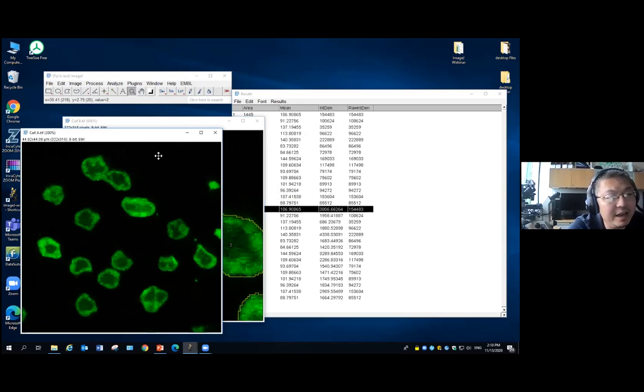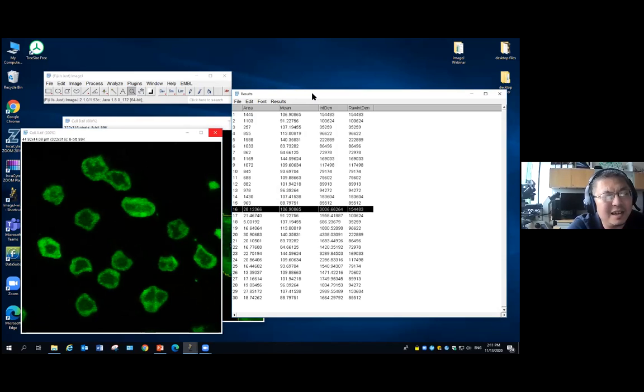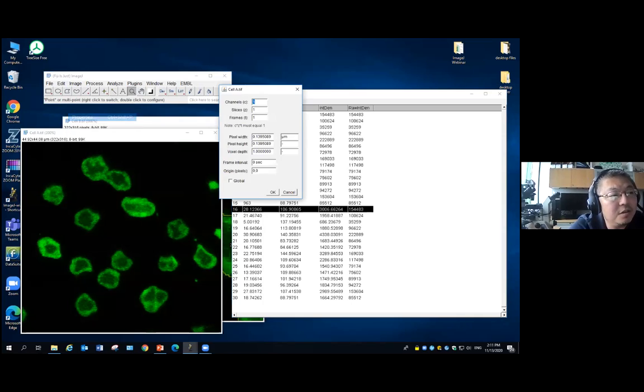But in the cell A, we kept the pixel scale information. Ready? So once we measure in the cell A, you will see here that the unit is a micron square. So first, when you do the area measurement, you need to first make sure what your pixel scale is, and that ImageJ reads it.